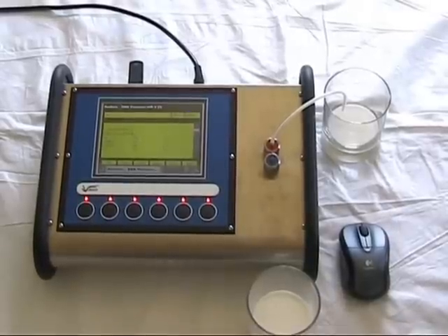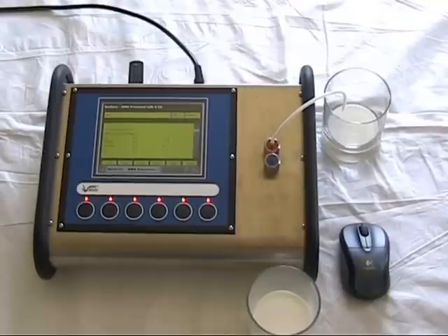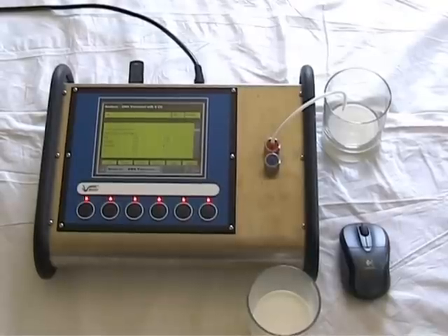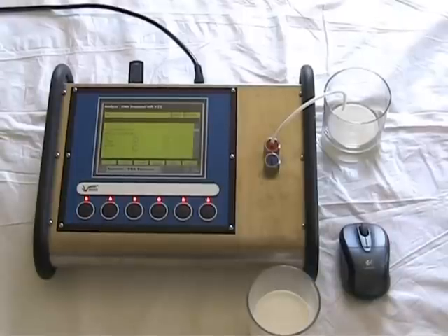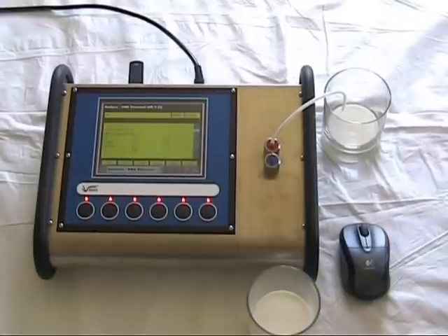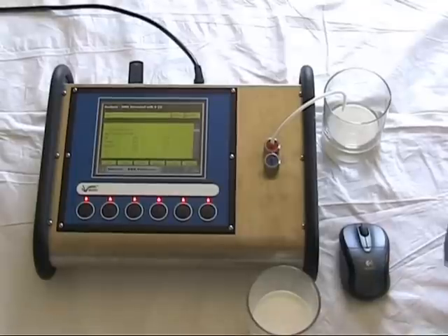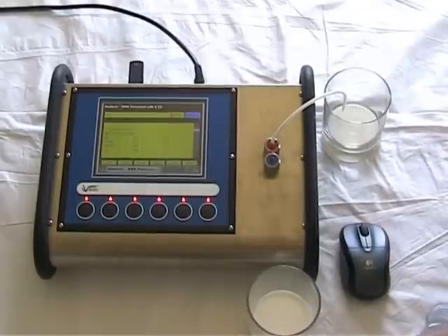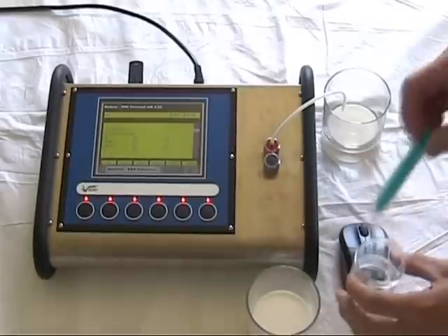After a measurement has been made, a number of milk samples can be measured in succession. And after you've completed the last milk sample, you need to clean the instrument. Cleaning is simple. A cleaning solution is provided. And here's some that I prepared earlier.